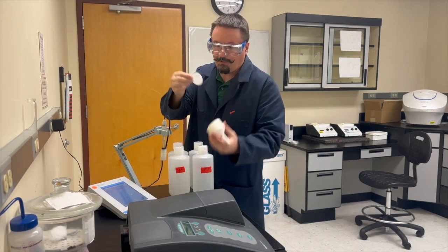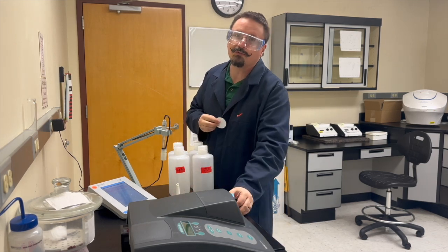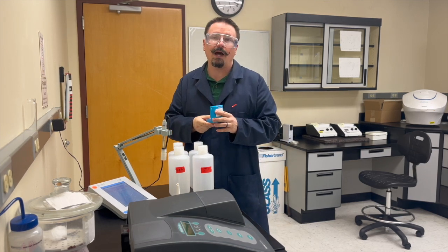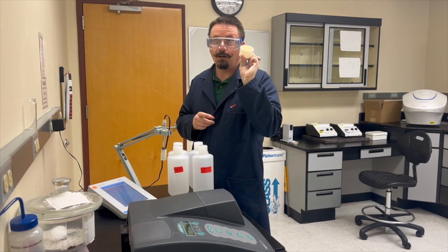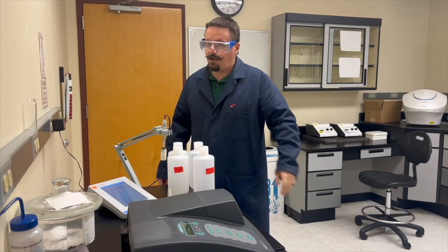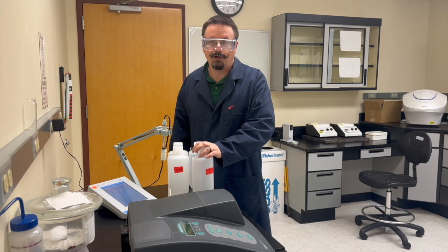We will have already put the filter paper in the oven for you, so it'll be baking in the oven and will be 100% dry. When you're ready, get your filter paper out of the oven, get its dry mass, put it in the Buchner funnel with your vacuum flask, and filter out that 500 milliliters. That's where you'll collect whatever dirt, plant life, bugs — whatever those non-dissolved solids are.